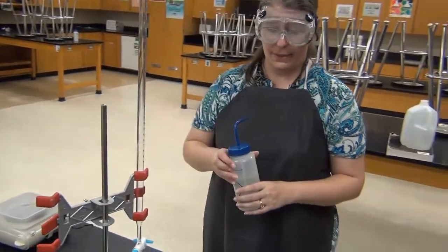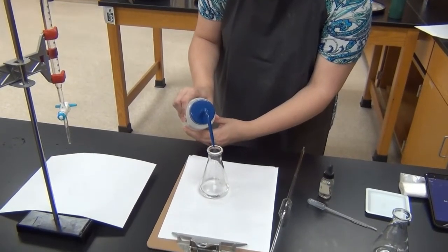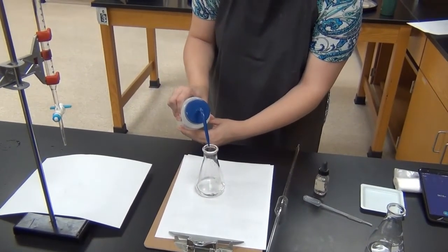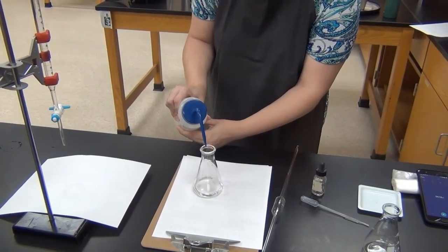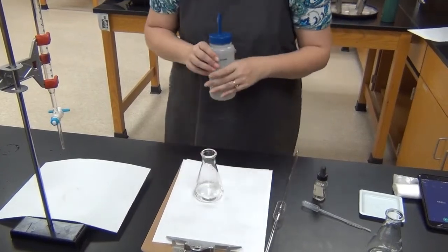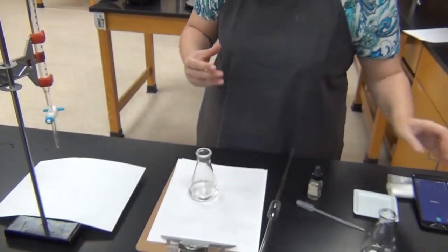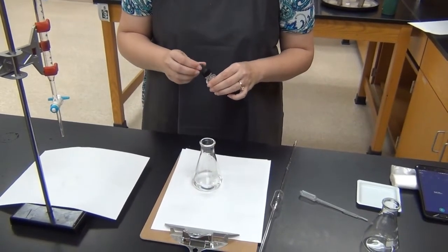You might think wait a minute, isn't that going to change the concentration? But all of the acid in my original sample came out of that 25 milliliters. So even if I add extra water now, I'm still going to use that initial 25 milliliters to figure out the molarity of the acid in the end.